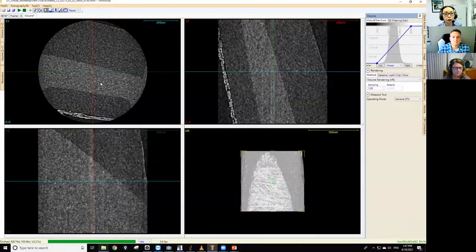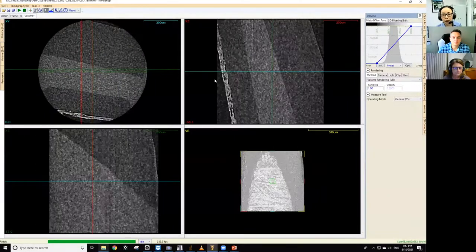Okay, so let me see. I think the top right cross section is the easiest one to see. This is another part that's potentially confusing, but in projections, usually dark color means higher density. Once you do the reconstruction, the lighter color usually means higher density. So again, you see the center part, UV resin, having a higher density than the parafilm or this polymer sheet.